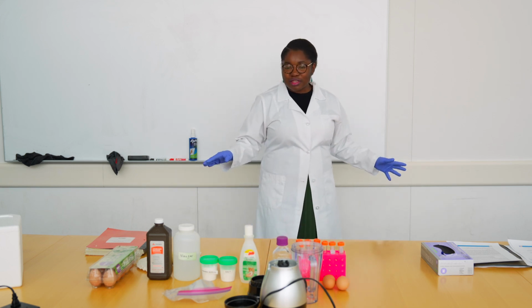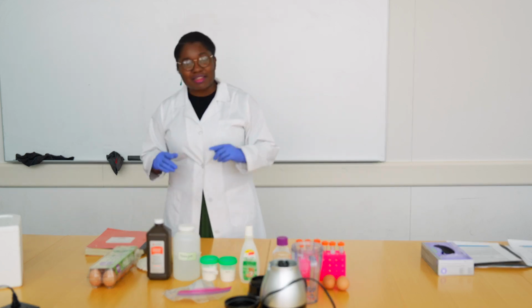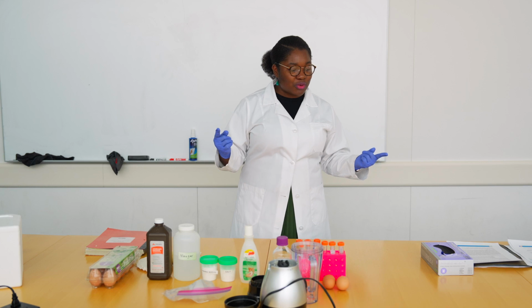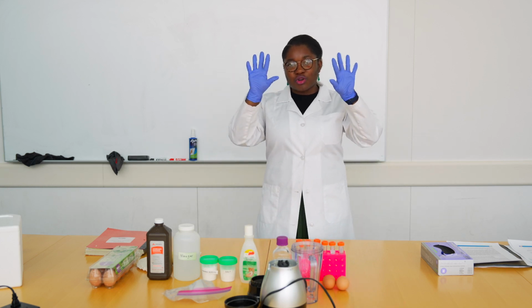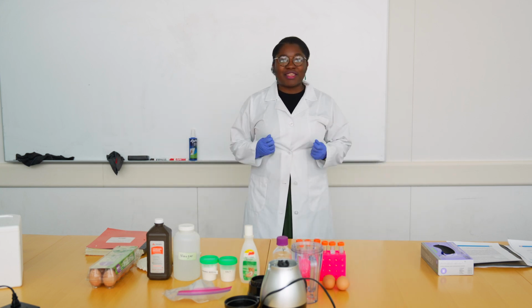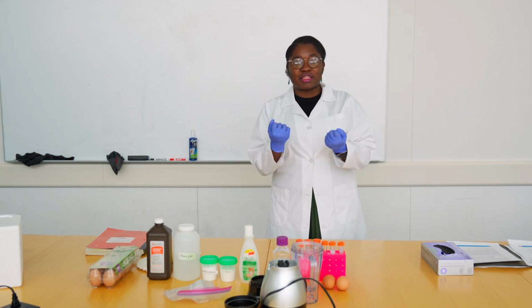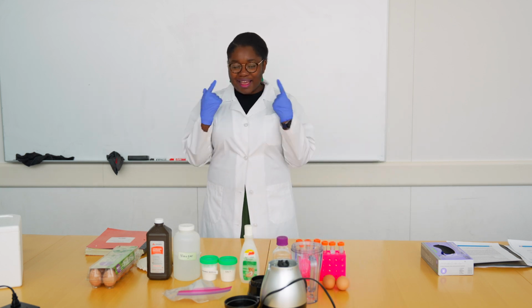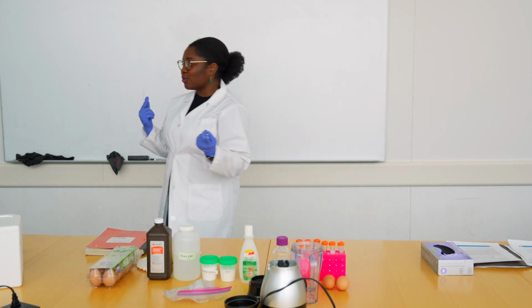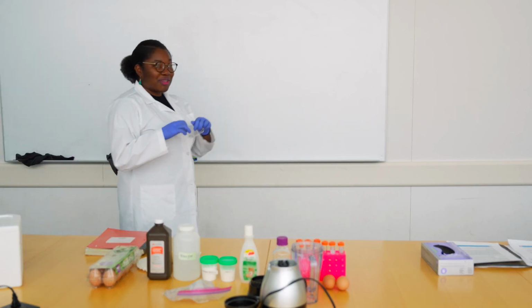While we are on the subject, before we start the activity, let me tell you that safety comes first when you're doing experiments. So you have to make sure that you're always wearing your gloves. You have a nice protective gear, like a lab coat, for example, and you're protecting your skin, your hands, your eyes. I have my eyeglasses, but I could also use those safety glasses that could come in with your kit.